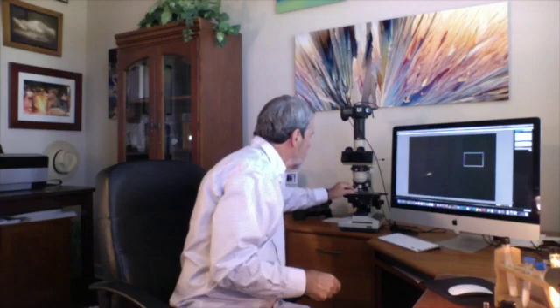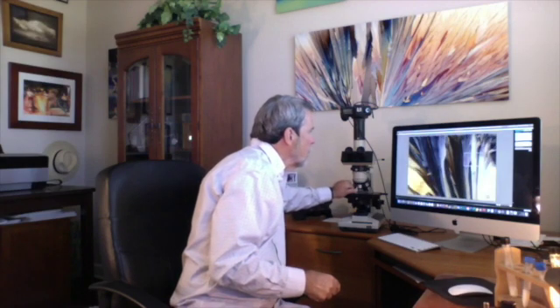What I do is I dissolve that in a solvent and then put it on a microscope slide and allow it to dry. What happens is that the crystals form a thin layer. And these crystals now don't look like much, but under the microscope, as I'm going to show you in a second on the monitor here, they create color and pattern that is unique for every event. It's like growing snowflakes. It's going to be different every time.